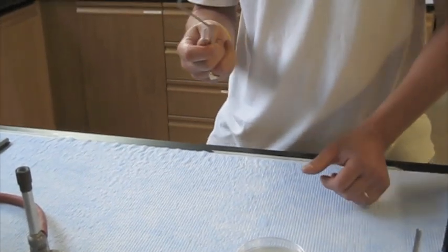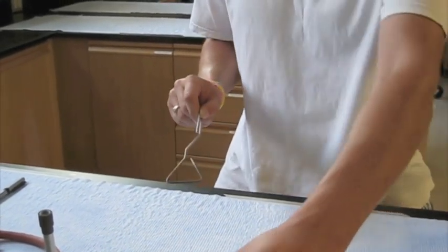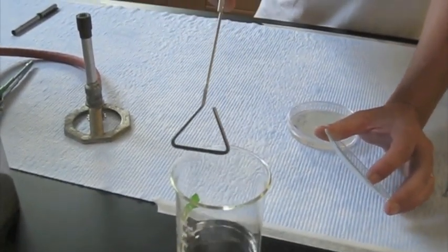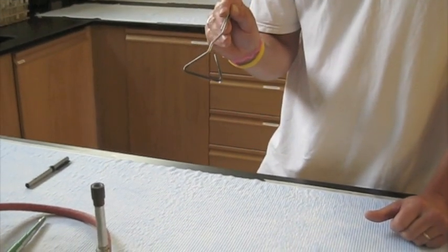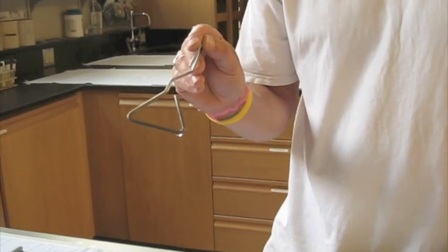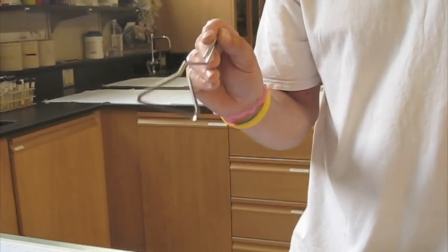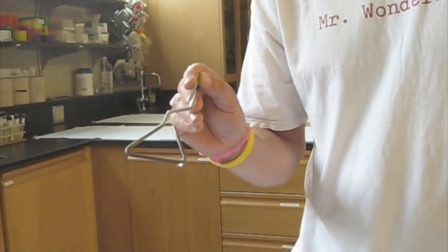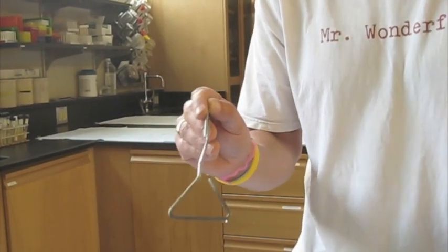I can set this down. Now I need to sterilize this. If I heat sterilize this in the flame, it will be way too hot and would kill all the bugs. So what I do is we dip it into the alcohol, carefully pass it through the flame, not holding it in the flame, and the alcohol will ignite. Be careful at this point because it can be dripping and on fire, so you want to make sure that you're careful. That will sterilize this without getting it too hot. Again, I didn't hold it in the flame. I just passed it through the flame to ignite the alcohol, making sure not to drip over the beaker of alcohol and set it on fire.